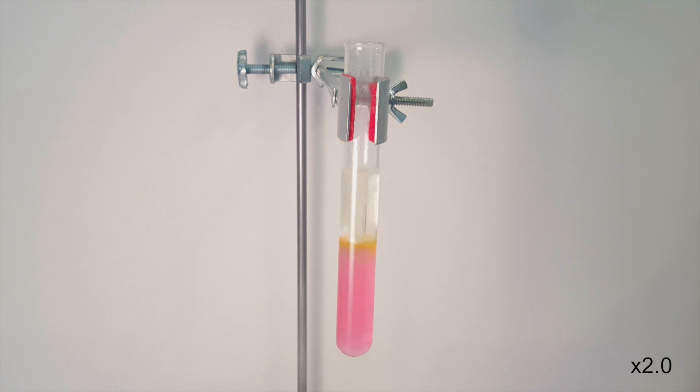Unfortunately, this trial failed. Besides the entertaining bit of sodium that was going wild for the hydrogen gas, not much happened to the large piece. It just basically sat there on top of the water and peacefully bubbled away. I tried to agitate the solution with my pipette, which made the sodium jump up for sure, but actually made the gasoline a cloudy consistency.